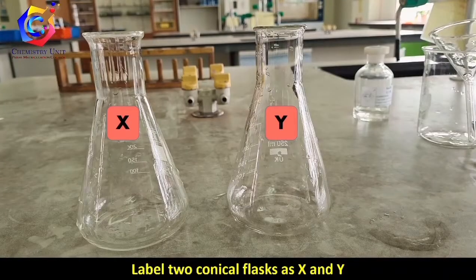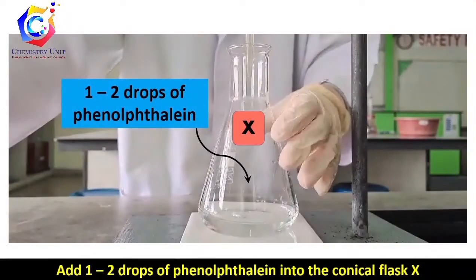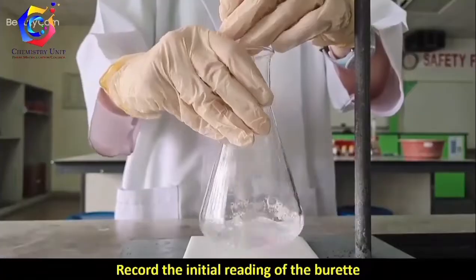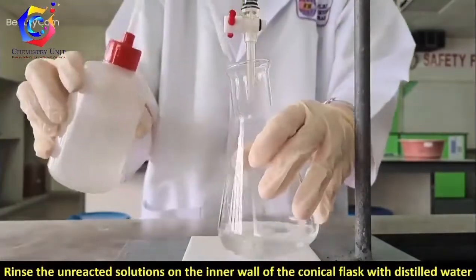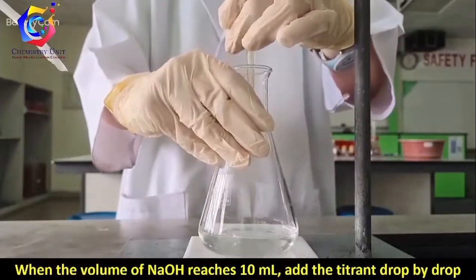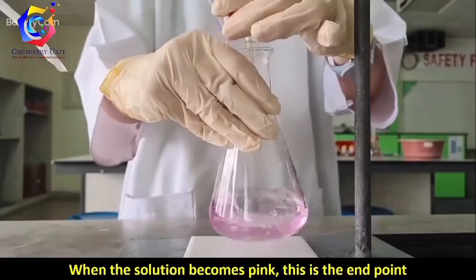Now let's proceed with part C. Label 2 conical flasks X and Y. Pipette 25 ml of 0.1 molar acetic acid into each conical flask, then add 1 or 2 drops of phenolphthalein. Record the initial reading of the burette, then titrate the acetic acid with 0.2 molar sodium hydroxide, rinsing the inner wall of the conical flask with distilled water. When the volume of sodium hydroxide reaches 10 ml, add the titrant drop by drop. When the solution turns pink, this is the endpoint.